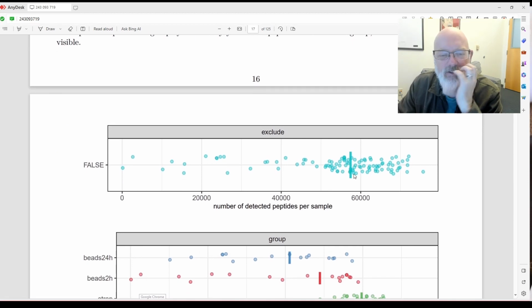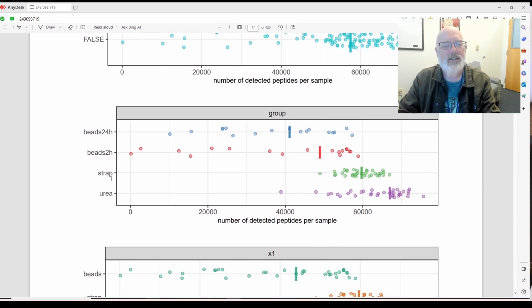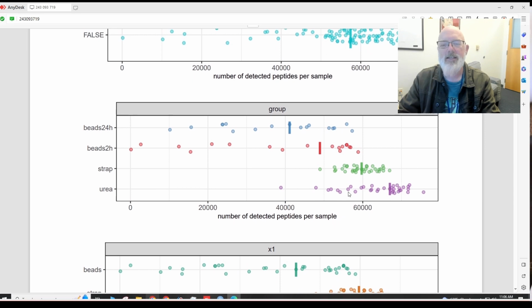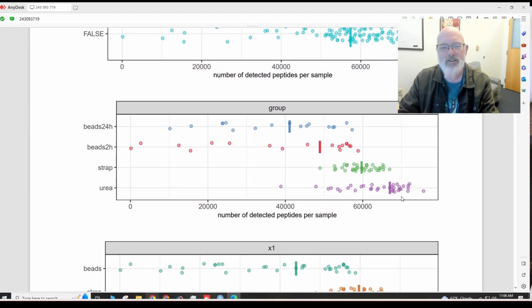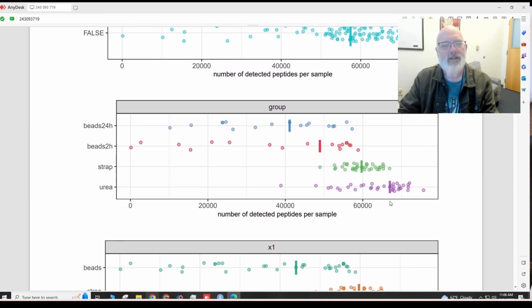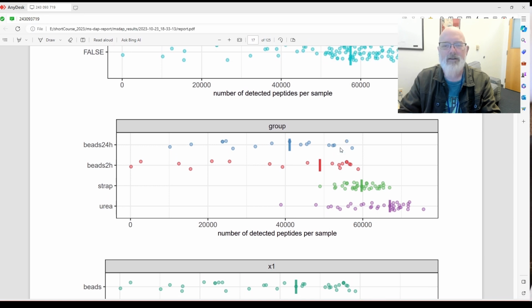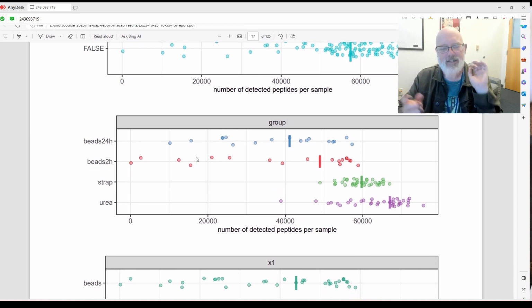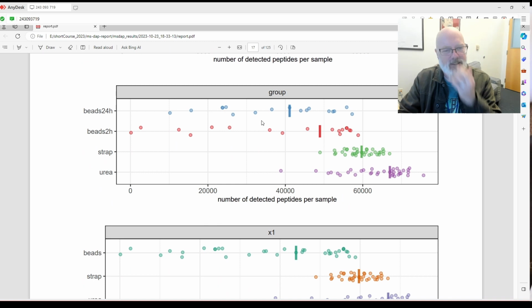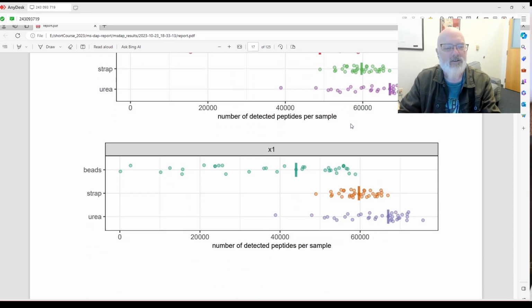Let's see. So this kind of shows the same thing. Oh, this is kind of neat. So look at this. This is beads, 24 hours, 2 hours, S-trap and urea, number of peptides detected per sample. Oh, that's really kind of cool. So look at how the bead digest is all over the place where the S-trap and urea are not. And that means the new people in the group had a much easier time overall with S-traps and urea. And I believe this is because of the binding step with the PAC, or the particle activation capture. What does that stand for? Or the bead, the precipitation on the beads. I think that's the variable step. So when we do the bead digest on our KingFisher, it's way more consistent than when doing it by hand. So I think that's the step people had problems with. Or we just taught it incorrectly.